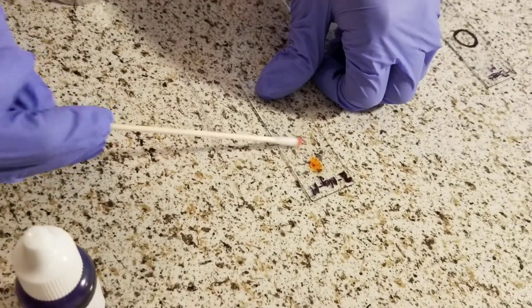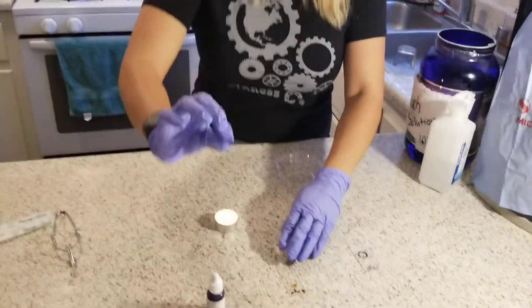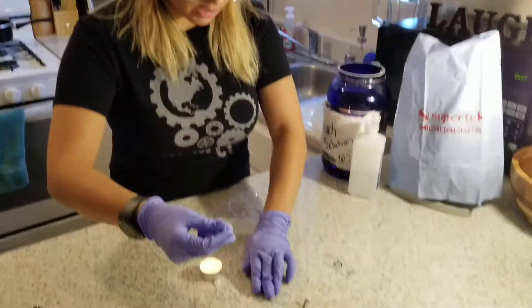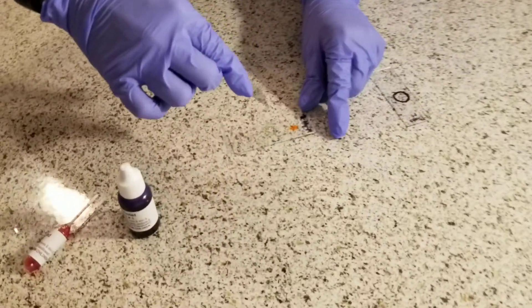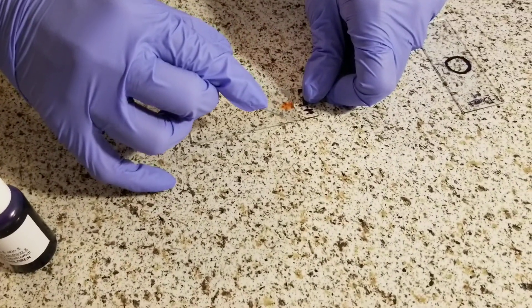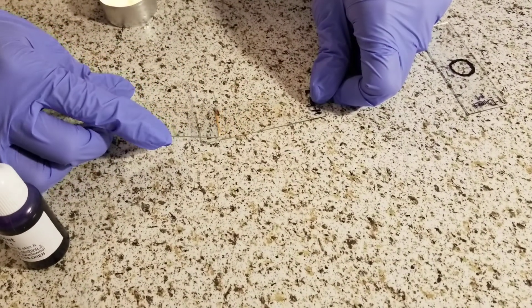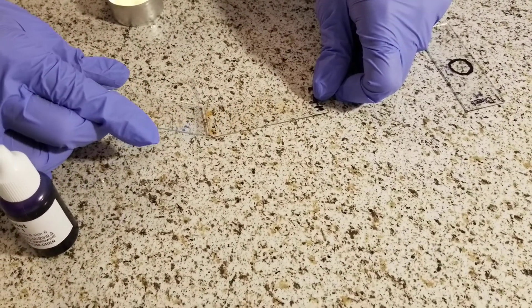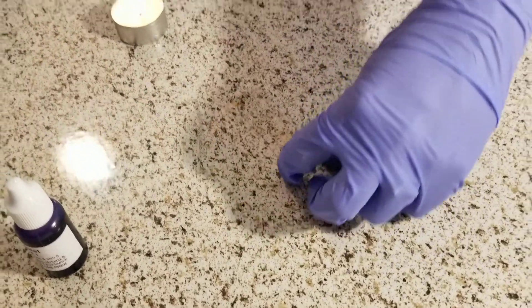Then with this slide I will take a clear blank slide with nothing on it and hold it at a 30-degree angle. I'm going to wipe the stain across the slide. In the end you should not be left with any liquid, so just make sure it's all done. Then I will let that air dry.